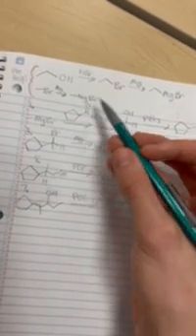And we basically did the same thing here. So we reacted this CH3Br with a magnesium to form a Grignard reagent, so we can use both these reagents during our process.